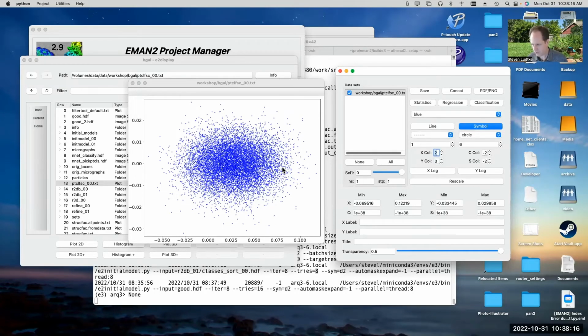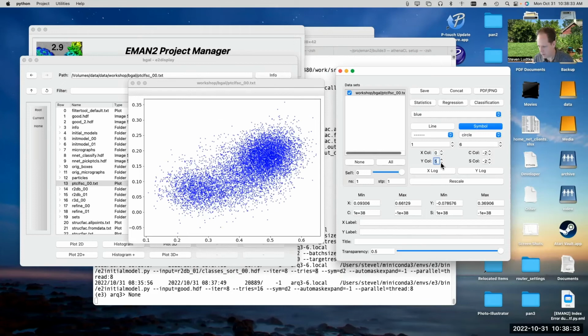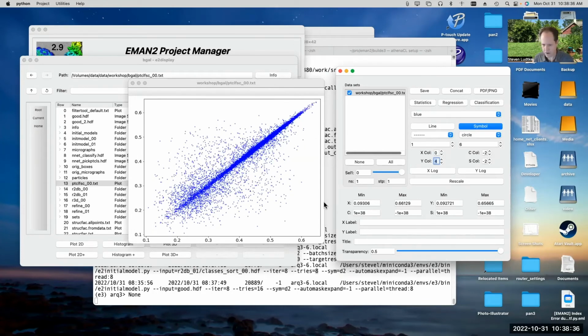Now the first 4 columns are from the second to last iteration in the refinement folder. Then the next set of 4 columns are from the last iteration. So you can compare the second to last iteration with the last iteration and see how self-consistent things are. So we can compare column 0 to column 4. If the refinement had perfectly converged and nothing was changing from one iteration to the next, you would see a perfect diagonal line here. So all of the stuff out here is probably garbage because it didn't refine very well.